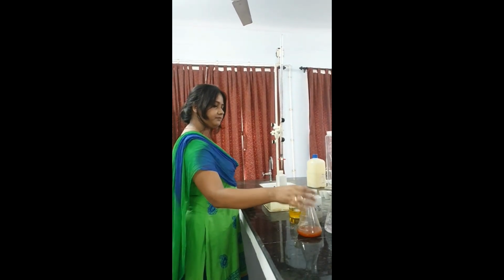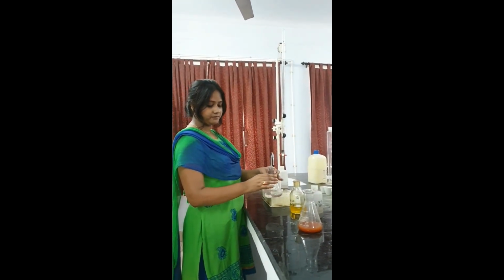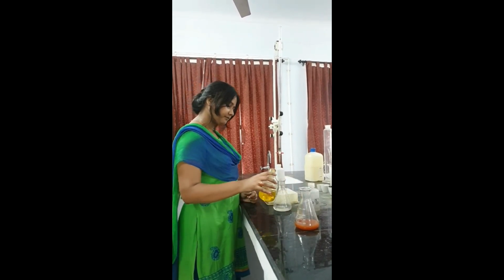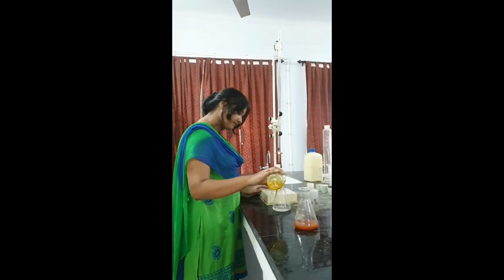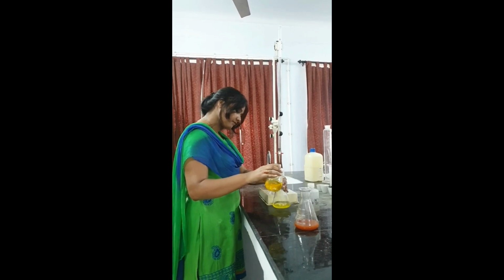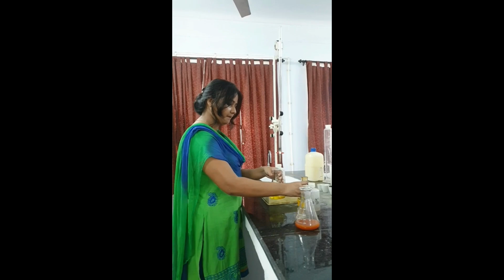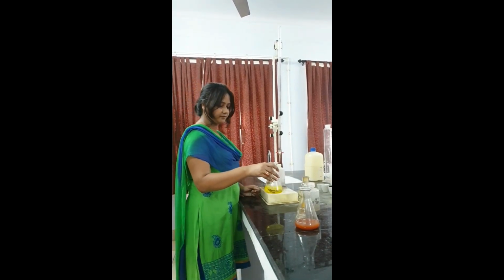Similarly, we will take distilled water here. If you remember, in the case of hardness also we had taken a blank. Similarly, distilled water or blank we will take in the chloride test also. We will add a few drops of potassium chromate indicator as we have done for the sample of water. We have also noted down the final volume of titrant for the sample. See, the yellow color has developed in the blank also, after the indicator was added to the distilled water.